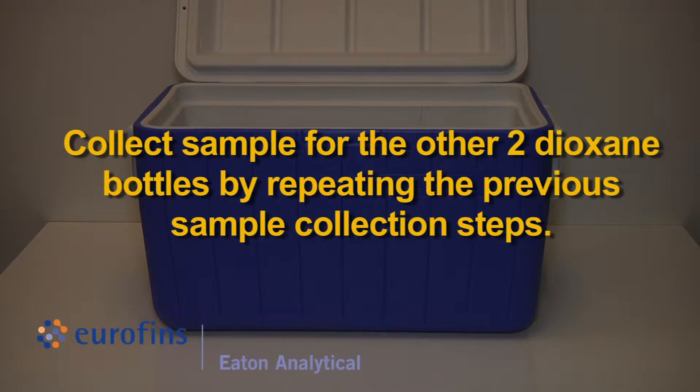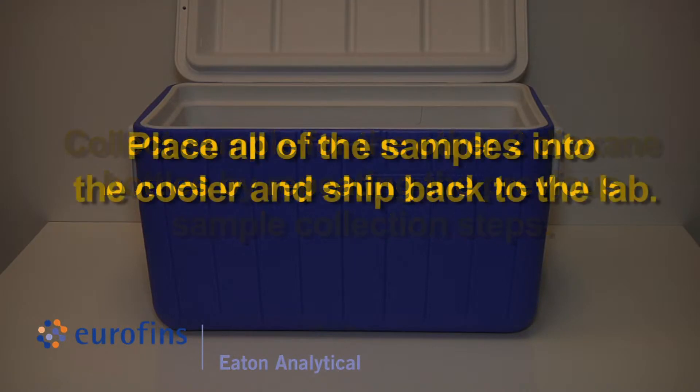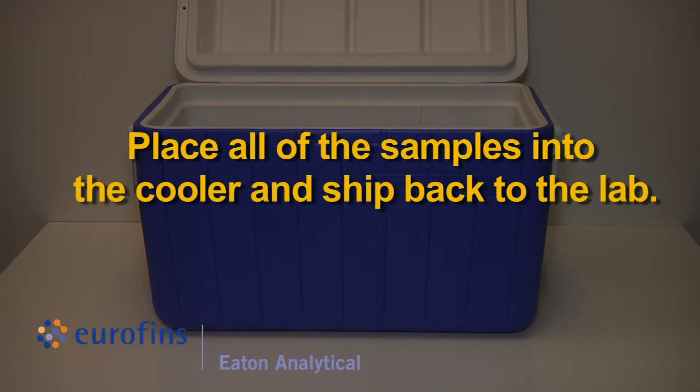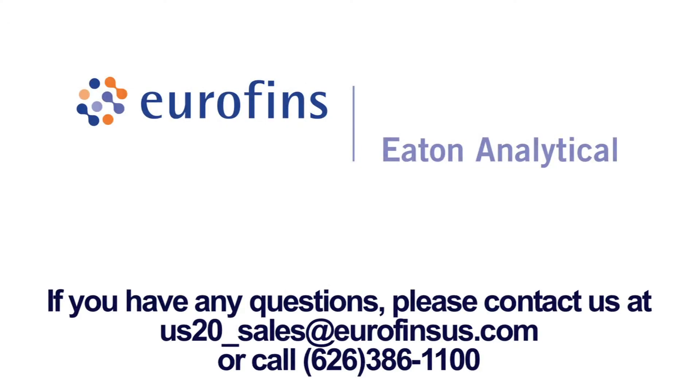Collect sample for the other two dioxane bottles by repeating the previous sample collection steps. Place all of the samples in the cooler and ship back to the lab. Please refer to Eurofins Eaton Analytical's written sampling instructions for specific details.